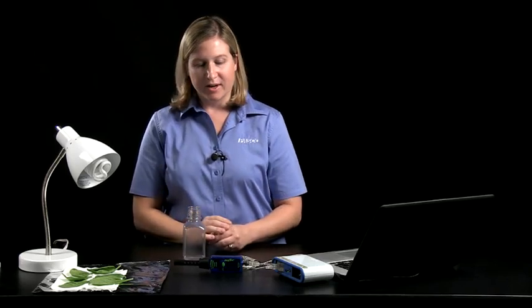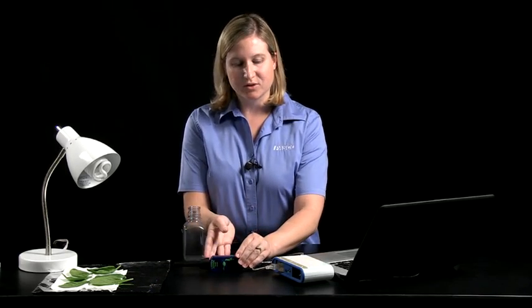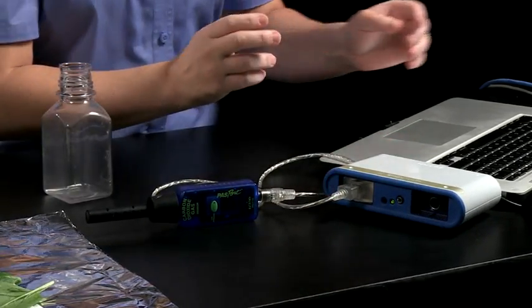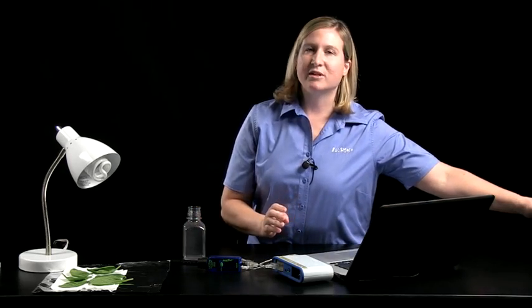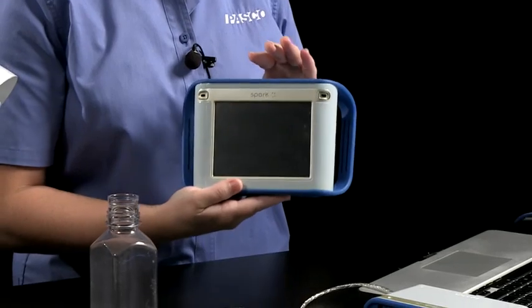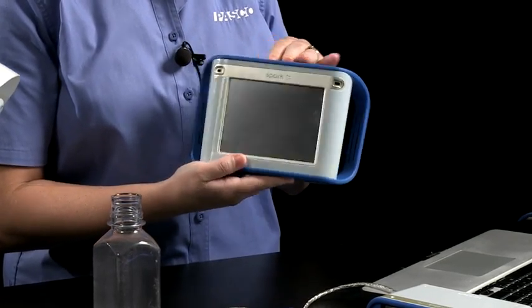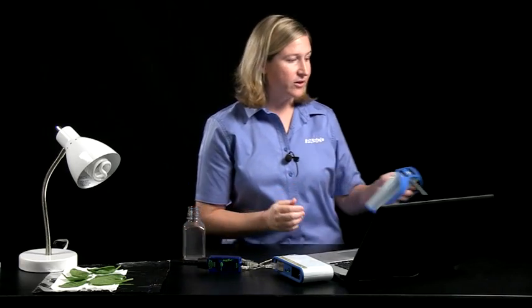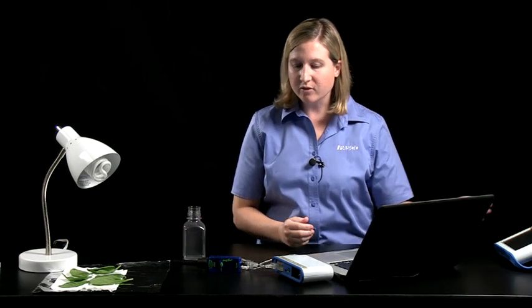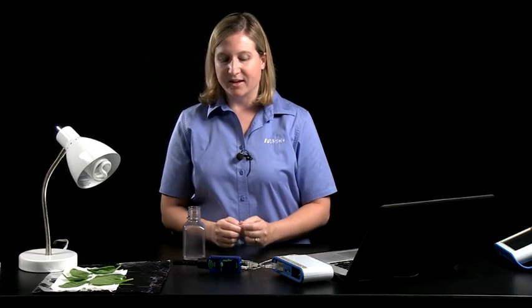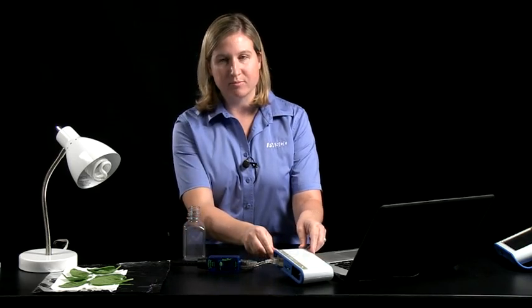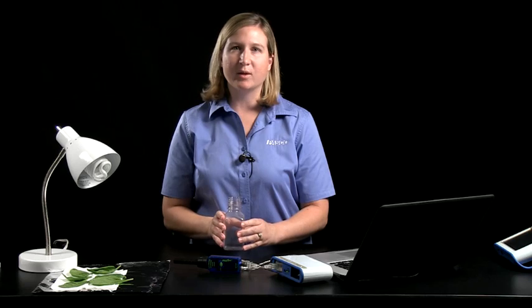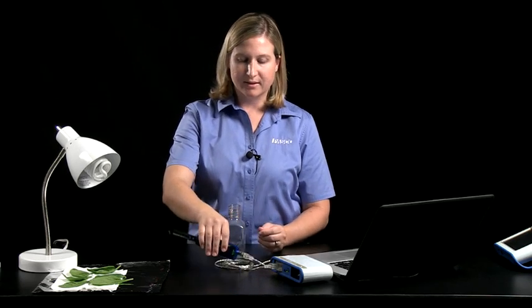So to get started, I already connected my carbon dioxide sensor to my computer via the Spark Link. I'll be using a computer for today's demonstration, but the lab could just as easily be done on the Spark Science Learning System. My carbon dioxide sensor is already connected to my computer through the extension cable, and I'm going to calibrate my carbon dioxide sensor before beginning the lab.